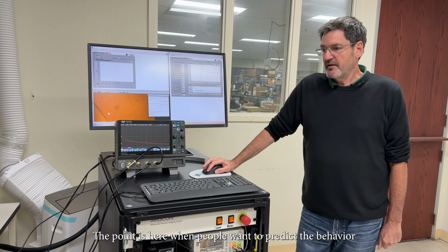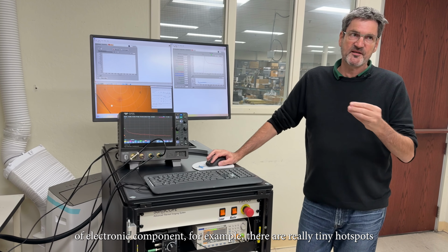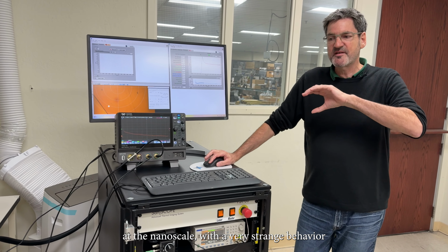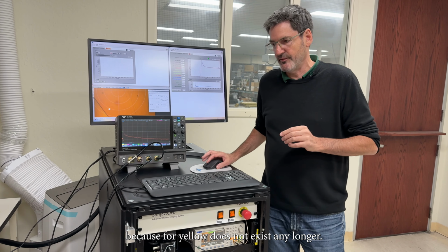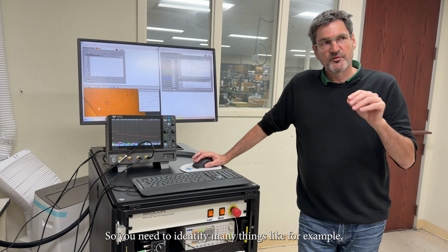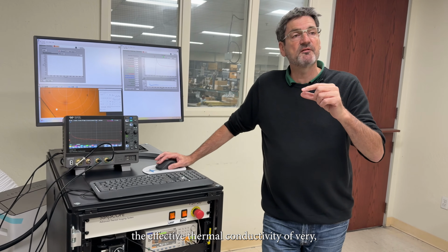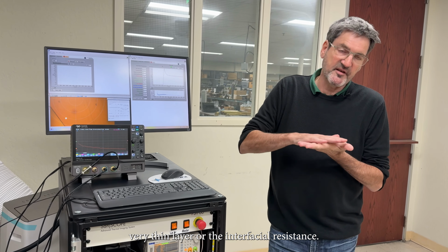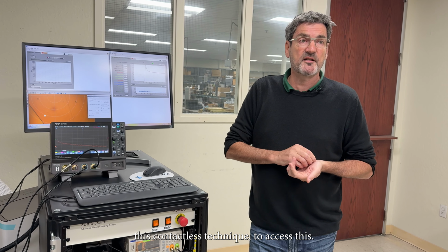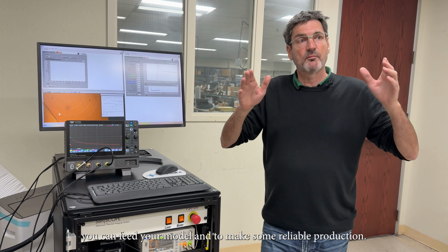The point is here, when people want to predict the behavior of electronic components, for example, there are really tiny hotspots at the nanoscale with a very strange behavior because Fourier's law does not exist any longer. So physical processes are very different. So you need to identify many things, like, for example, the effective thermal conductivity of very, very thin layers or the interfacial thermal resistance. And there is no other way than this contactless technique to access this. And as soon as you get this, you can feed your model and make some reliable predictions.